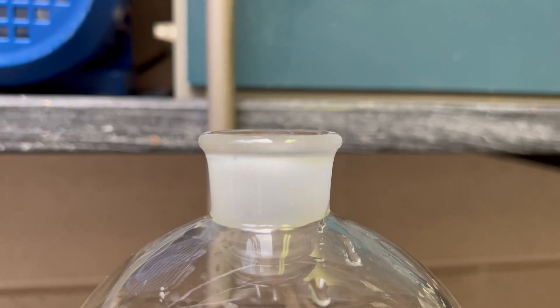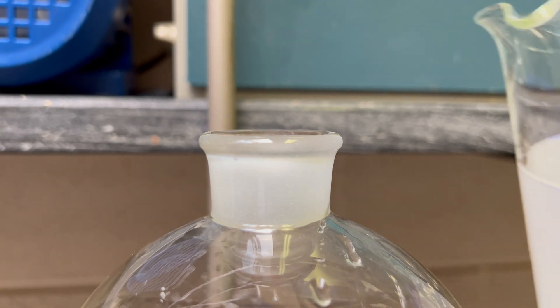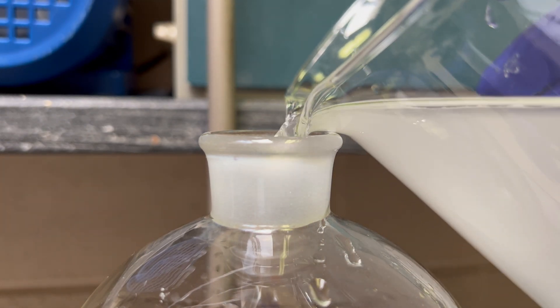Use a separation funnel to separate the aqueous layer from the toluene that is still present.